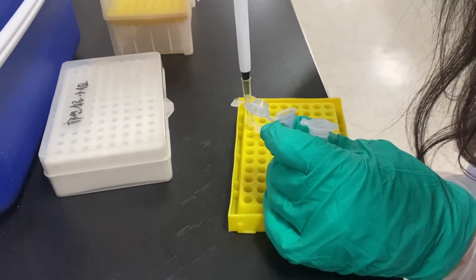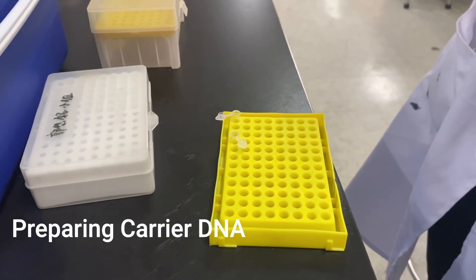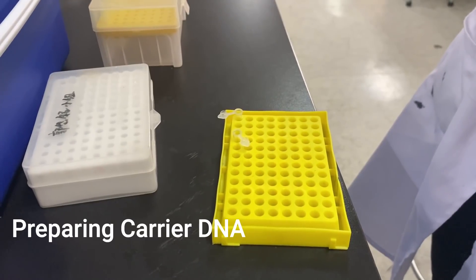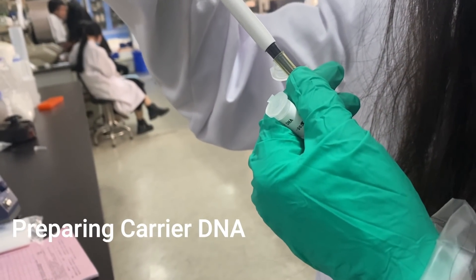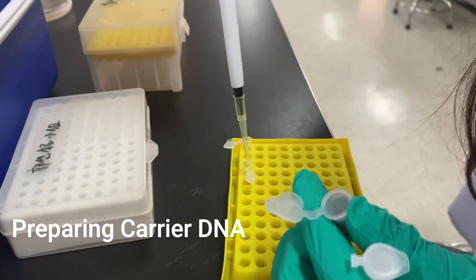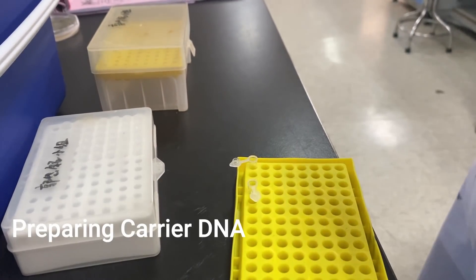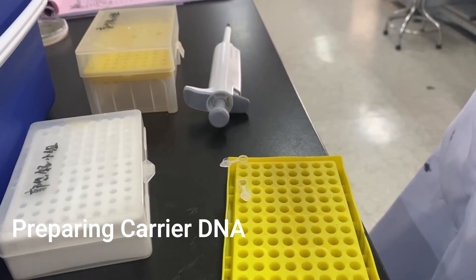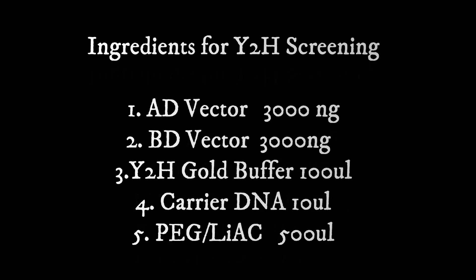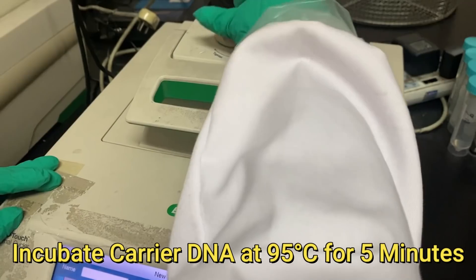At the first stage we need to prepare the carrier DNA for all samples. We can make it as a pool. Carrier DNA for each sample should be 10 ul. Here we are using five samples, so we will totally use 50 ul. We need to incubate the carrier DNA at 95 degrees Celsius for about five minutes.